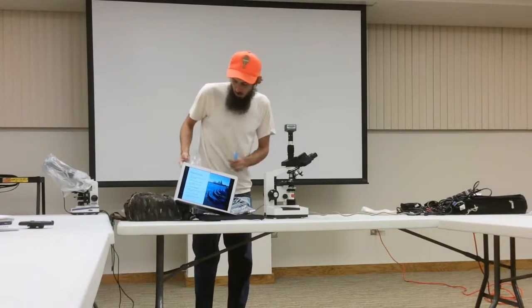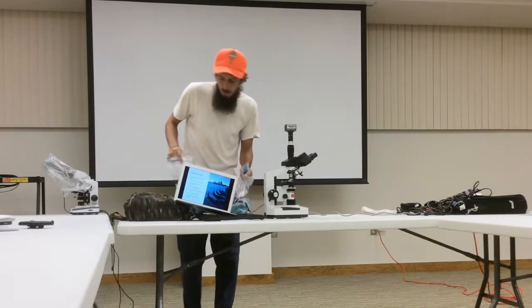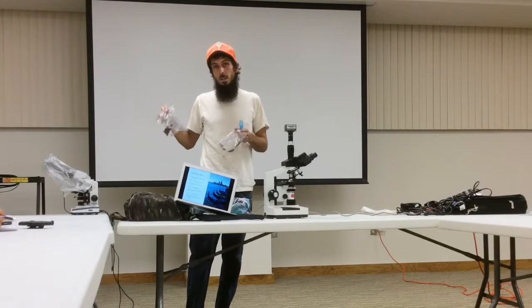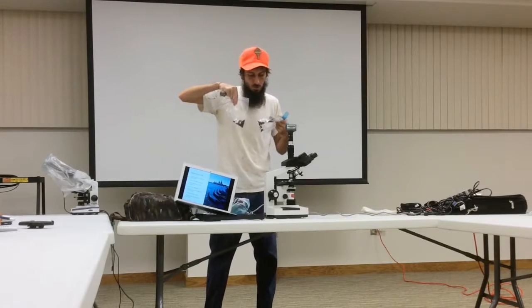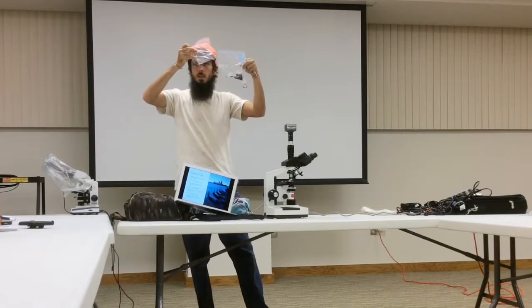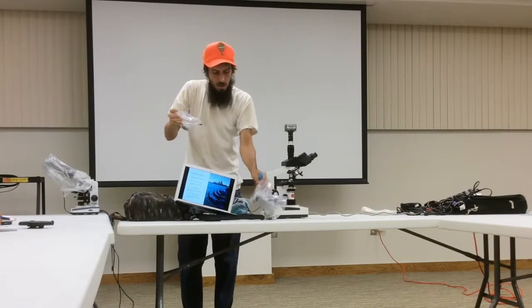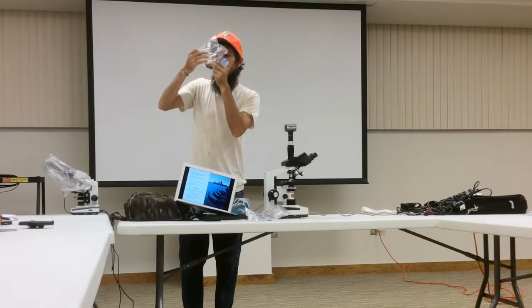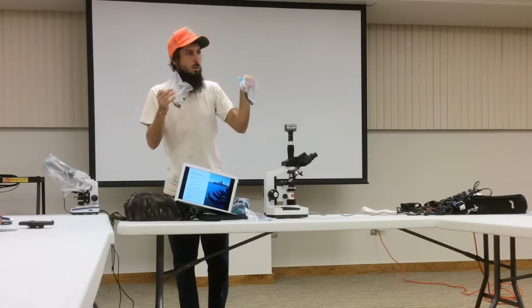So what I'm gonna do here is prepare my slide, and I want to be somewhat scientific and consistent, because if I prepare slides differently, I'll get different results. This is a pretty consistent way to prepare slides that I'm going to share with you. I have 3 different samples here. One is from an IMO pile, this one is from my garden outside, and this one is from another part of my garden, where they're all looking really healthy.